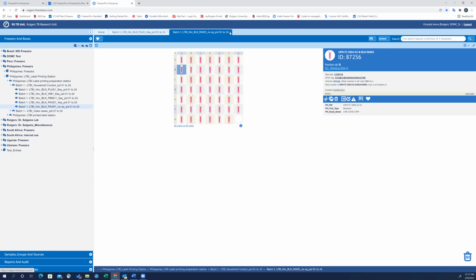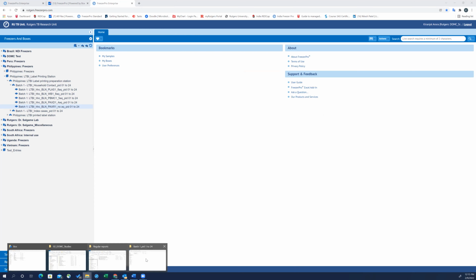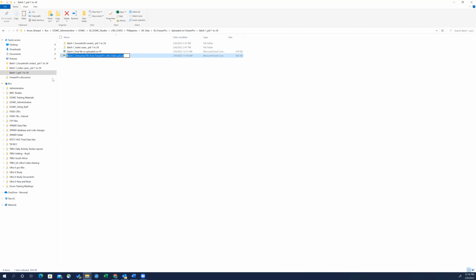All right. So the key message for this tutorial that I want to get across is whenever you are doing any bulk changes to the database by using the update function on the FreezerPro, do save a copy of the untouched file. It has happened many times when I was trying to make some changes and I wanted to revert back to the initial one, and I didn't have it saved, and that caused a lot of trouble for me in terms of remembering what was changed. Right now it's just one change, but it could be a lot more.